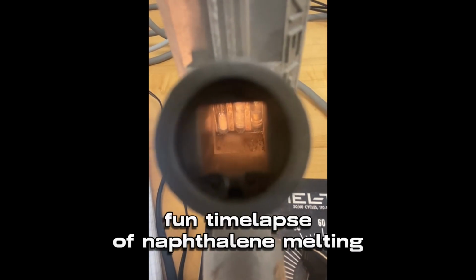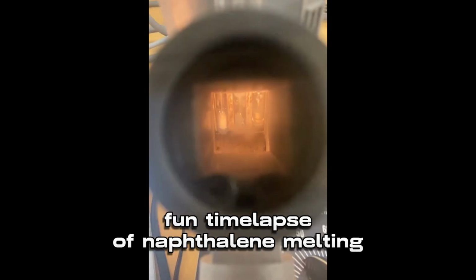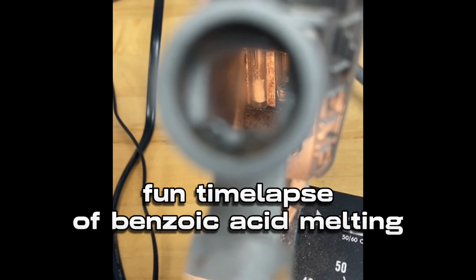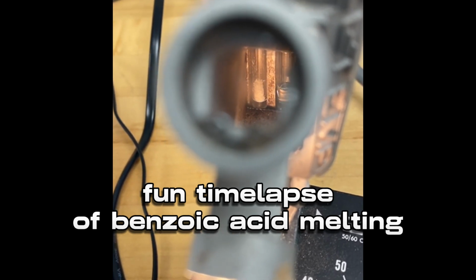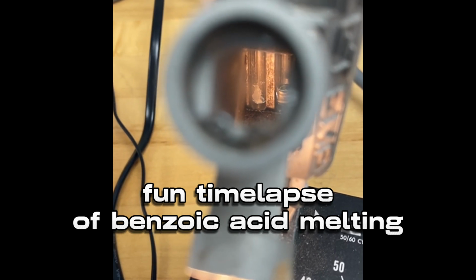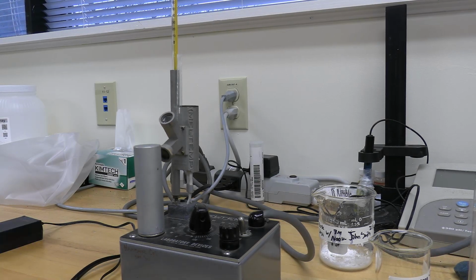I didn't get footage of p-bromoaniline melting, but here's footage of naphthalene and benzoic acid melting. You'll see when the compound first starts melting. You have to watch it very closely and then quickly record the first temperature in the range. Once it's done melting entirely, you can then record the second temperature in the range and have a fully recorded melting point range. Once you're done using the melting point apparatus, turn off the machine and take the tubes out.